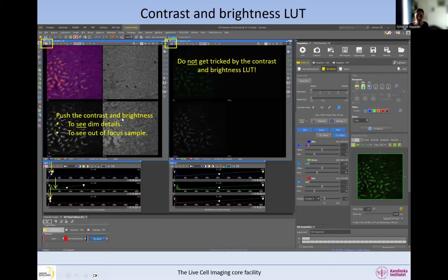However, although it is extremely useful to push brightness and contrast, it can trick you into thinking that your acquisition parameters are okay when really they are not. When we reset the brightness and contrast, this is really what the image looks like. This image is very, very dim. If you have the brightness and contrast pushed, you may think that the image is okay. But if you look at the histogram, you will see that most of the pixels are very close to 0. So you can see from the histogram that there is something wrong with the image, even if it looks like this because we've pushed brightness and contrast. So look at the histogram, toggle the brightness and contrast on and off, and play with that so that you use it when it's needed, but do not let it trick you into thinking that your image is correct when it's actually very, very dim.